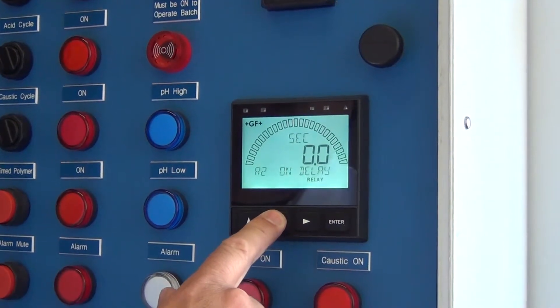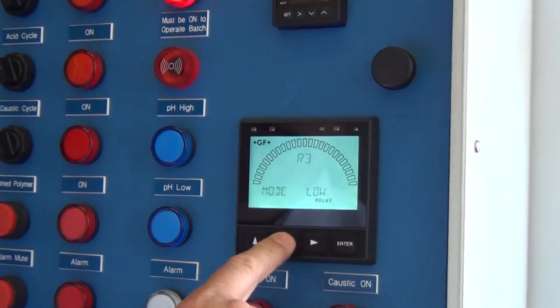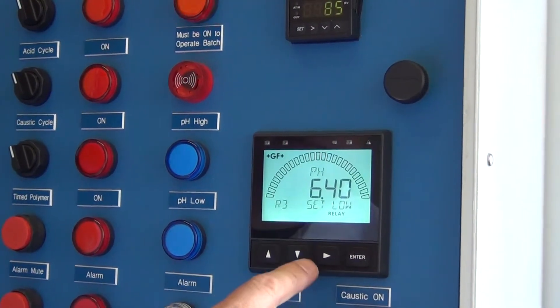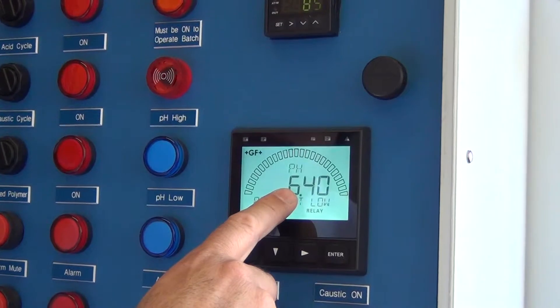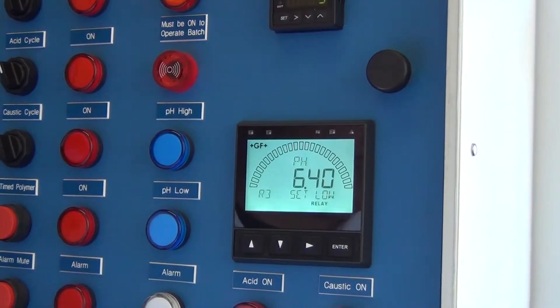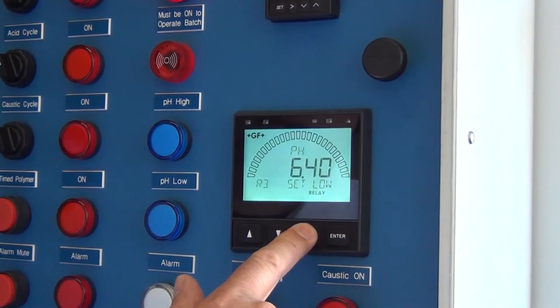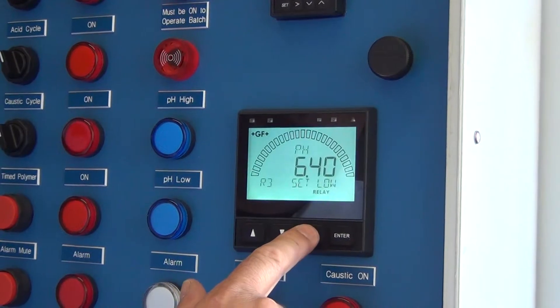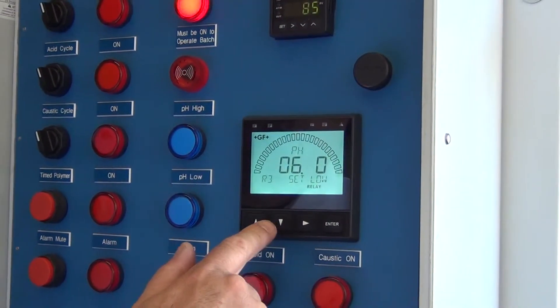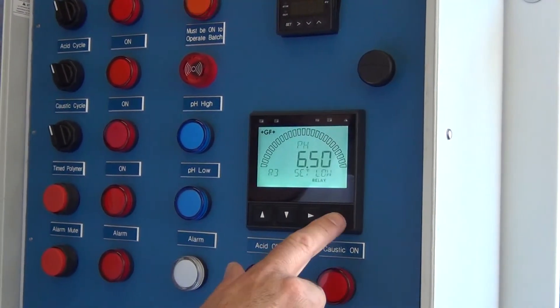If I want to change the caustic, that's R3. Right now we have it set at 6.4. If the pH falls below 6.4, then it'll start pumping caustic. To make that change, choose the digit — let's say instead of 6.4 we want 6.5 — and hit ENTER.